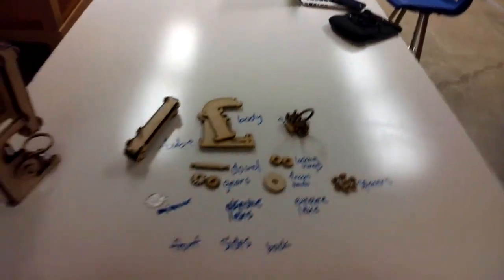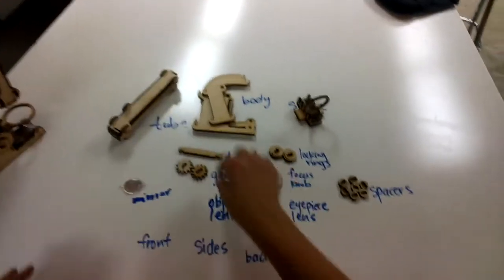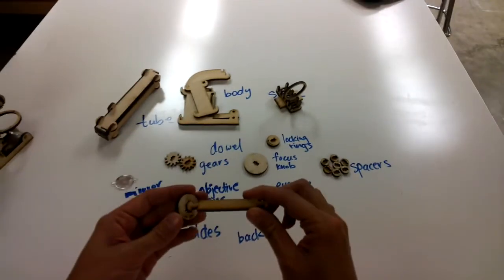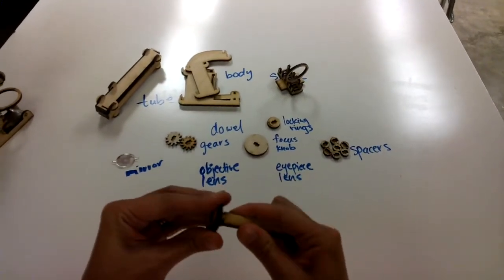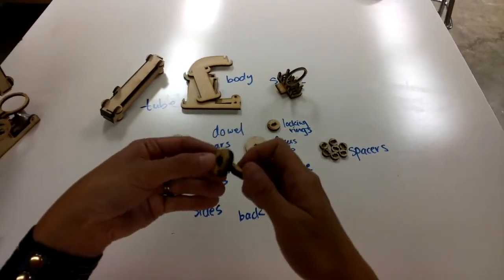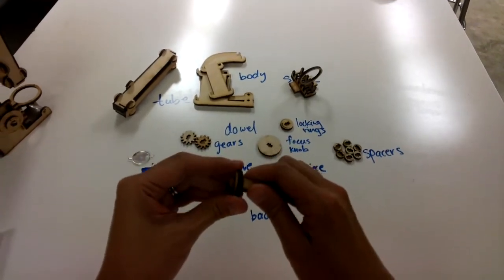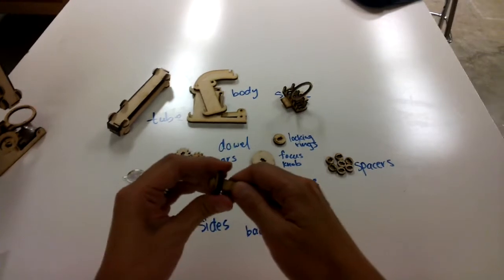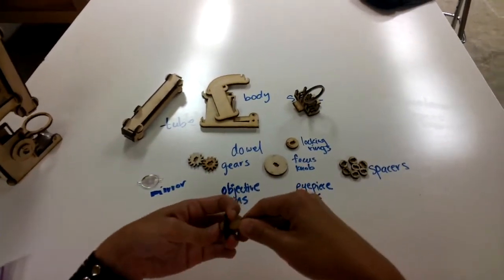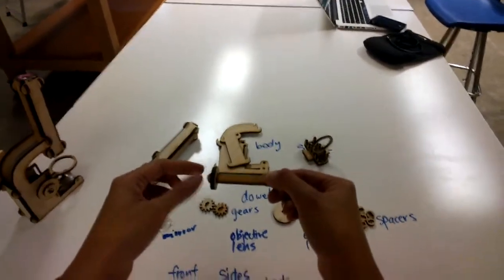Okay, so finally, we're going to create the body of the microscope. And so we're going to start by taking the dowel. We're going to slot one of the locking rings onto the dowel. So you go into here, and then the locking ring has the little notch, and that's to help you so that when you put the locking ring on the dowel, get it to the thin part, you're going to twist the dowel, and that will lock it. So now you can't really move. The locking ring is not going to fall off. Right? So you've got a dowel, and then you've got one locking ring.